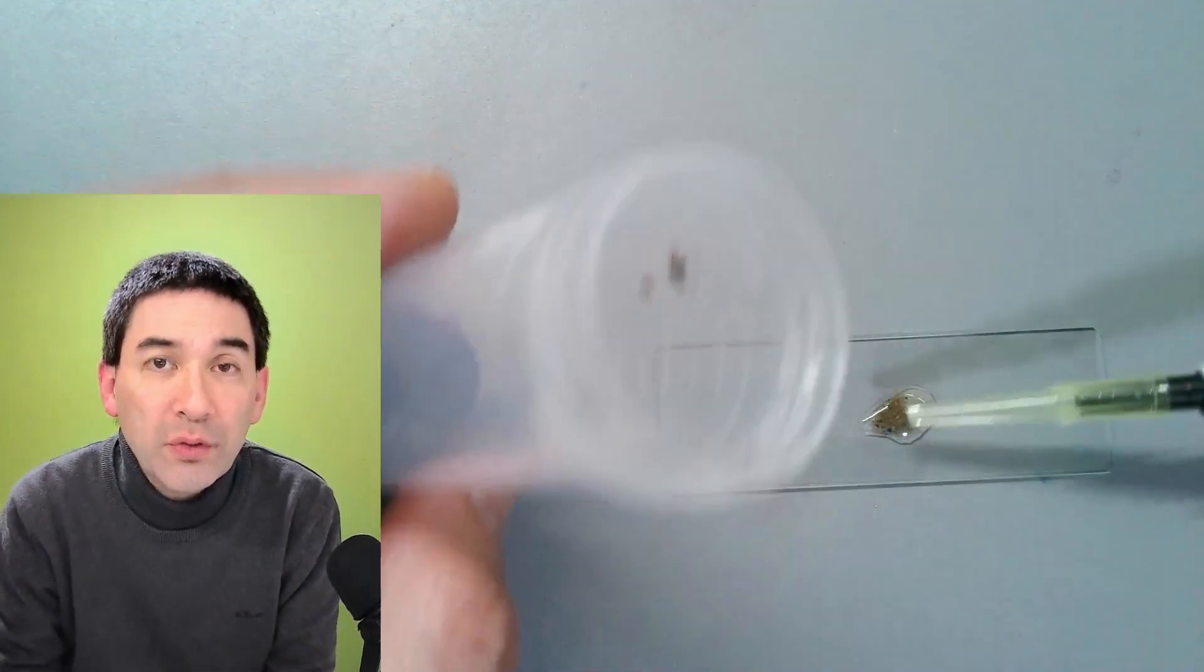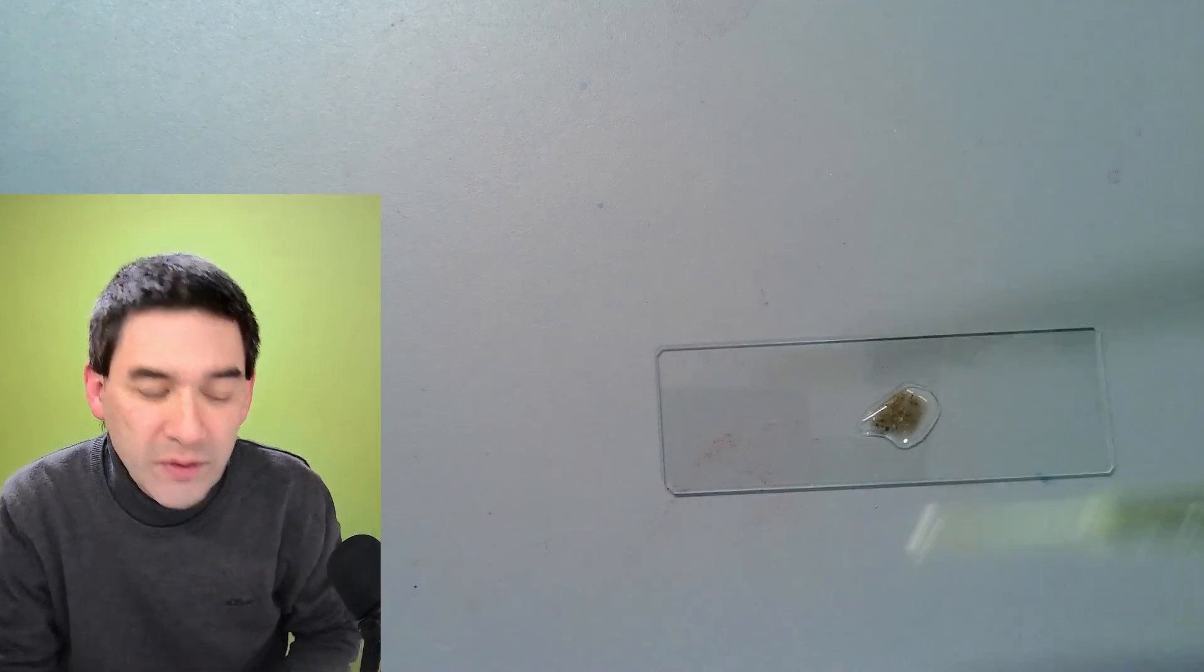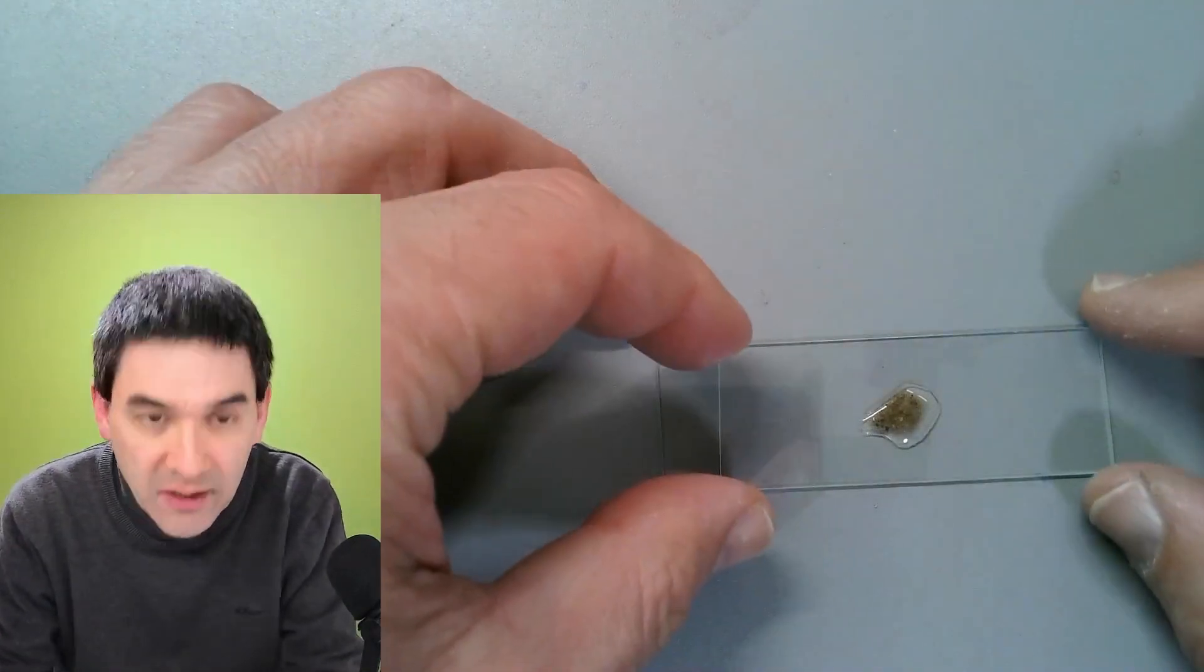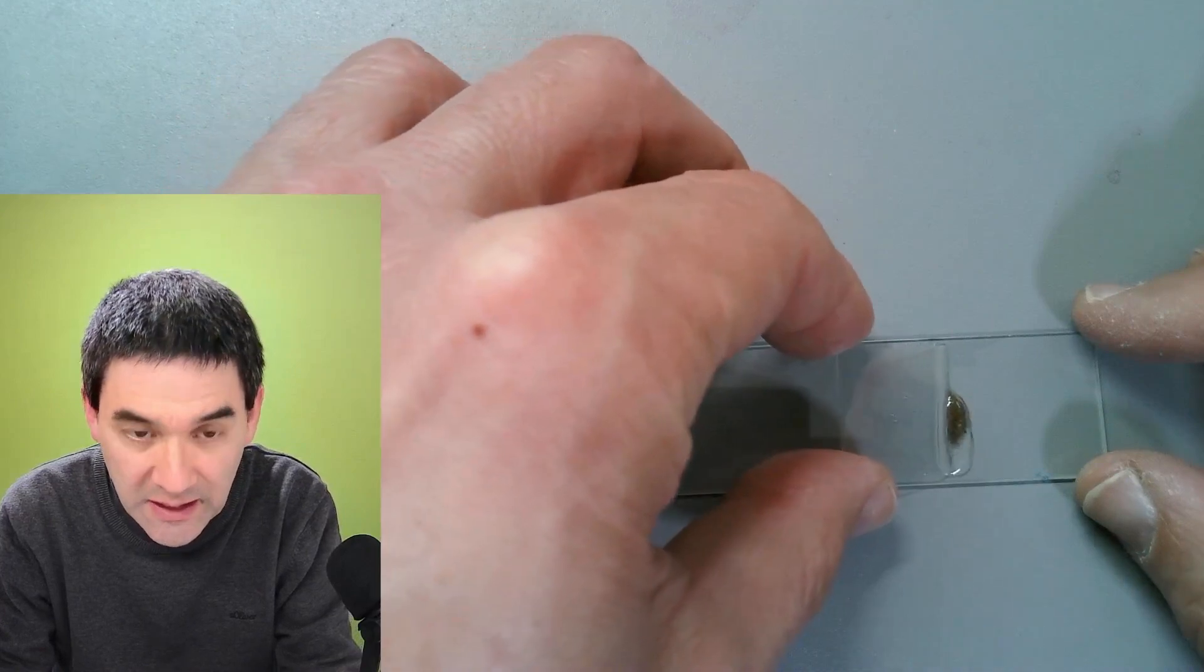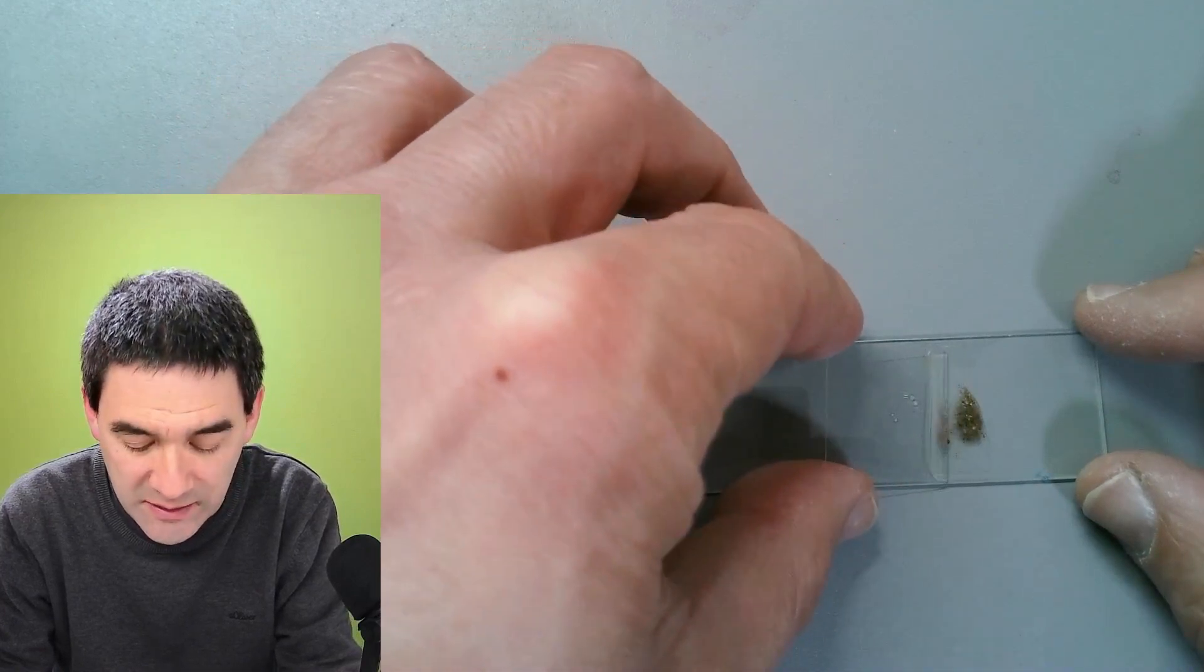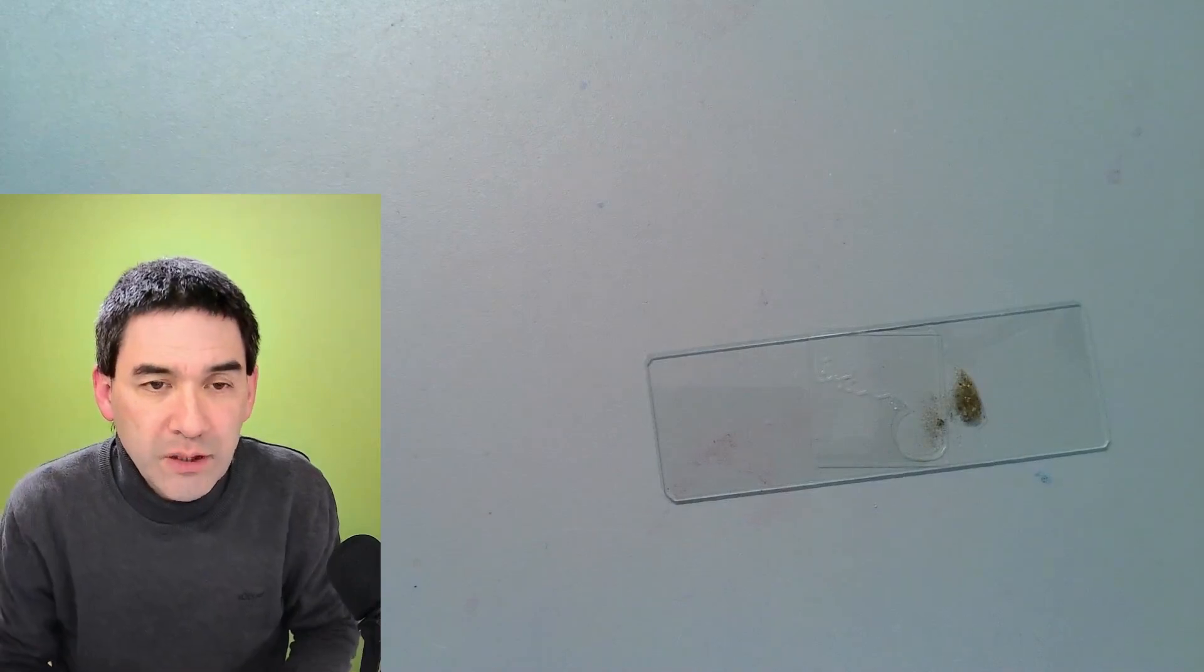This is of course going to be too thick and the cover glass will not be able to stay on the sand. So I have to push the sand to the side. I'm doing it like this and just basically push the sand to the side and then I simply lower the cover glass on top and that's pretty much it.